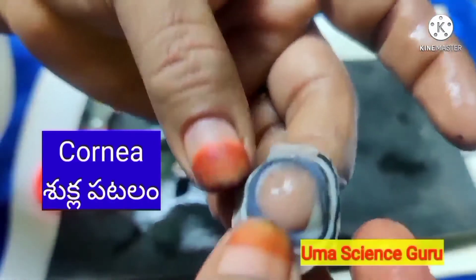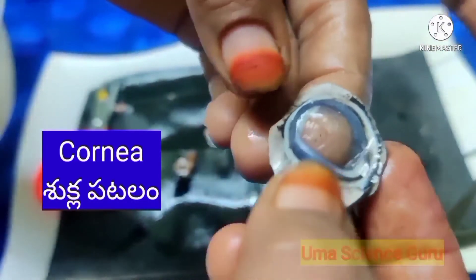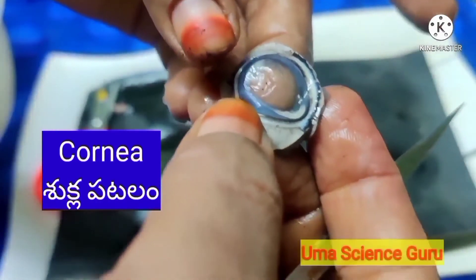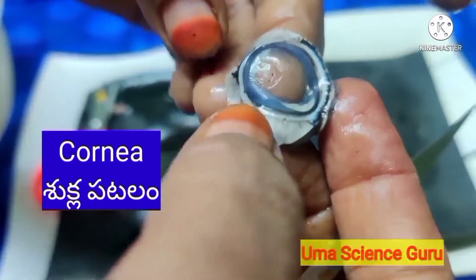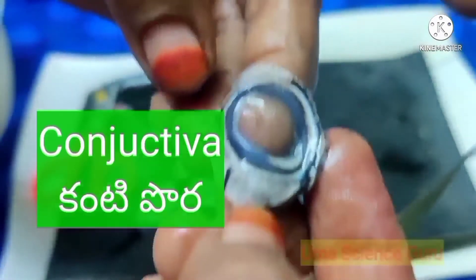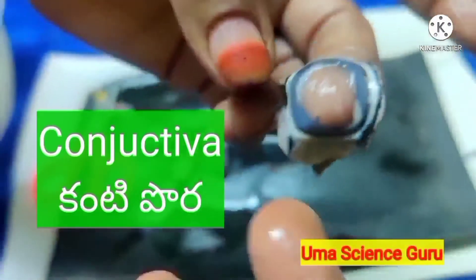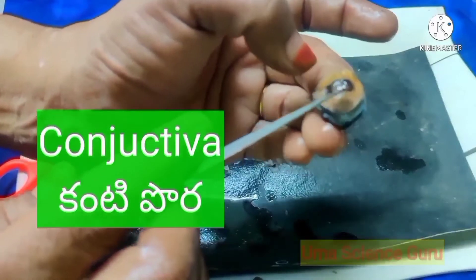The cornea protects the eye from direct exposure to light and allows light to pass inside the eye. It is covered outside by a thin transparent protective coat called the conjunctiva. Whenever unwanted substances come in contact with this layer, the lacrimal glands are stimulated to wash the substance out of the eye. The conjunctiva is protected and lubricated by the secretions of the lacrimal glands.